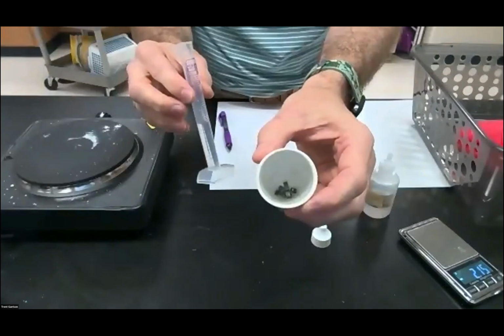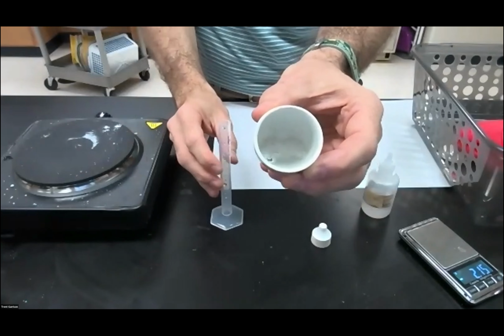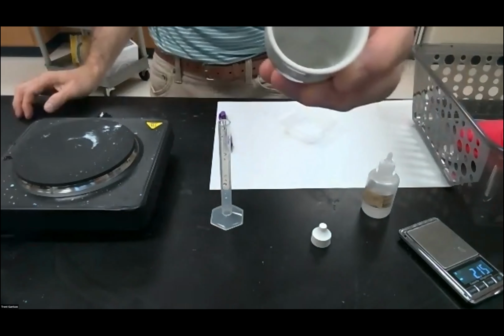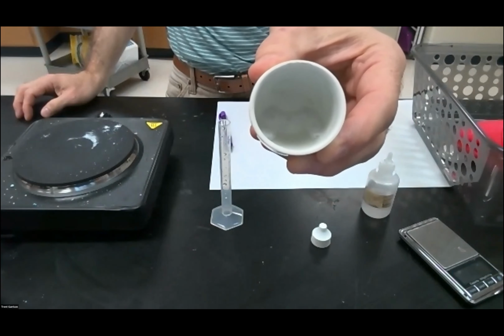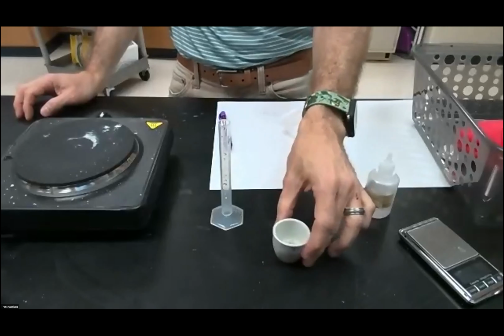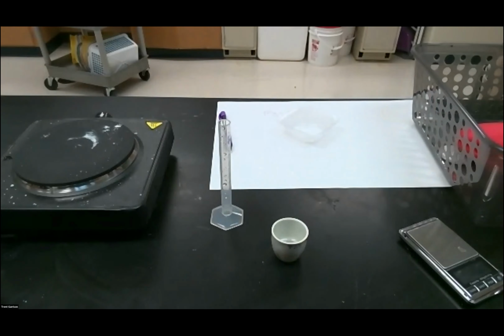As soon as I add it in here, what you're going to see is that it's going to start to sizzle. And there's a little bit of vapor. You don't want that vapor on you. But you can see that it's starting to dissolve this metal. Oh my gosh, what it's going to do is cause it to dissolve and turn into a new compound. That new compound is what we want to figure out the formula for. As that is working its way through there, I am not going to allow that to get into my lungs. It is bad. Ooh, that stinks bad.